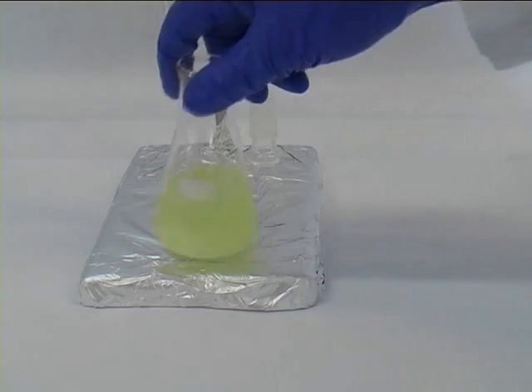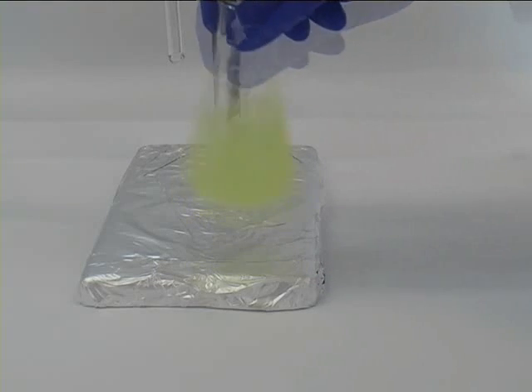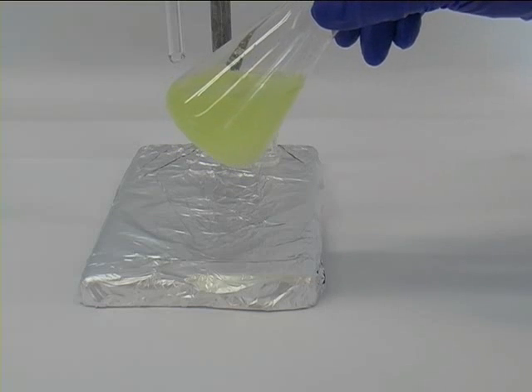So after we've added a portion of magnesium sulphate we swirl the solution. In case you will be left with chunks of magnesium sulphate you will need to add some more.